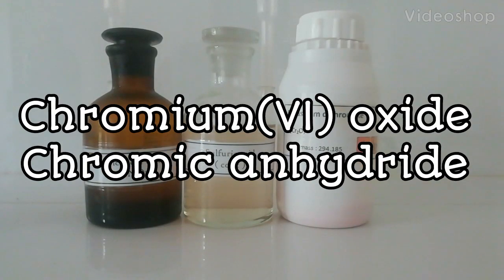In this video, you can watch how I made chromic anhydride, also known as chromium-6 oxide.